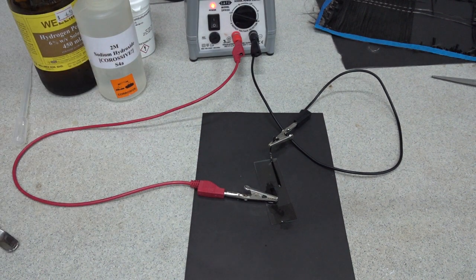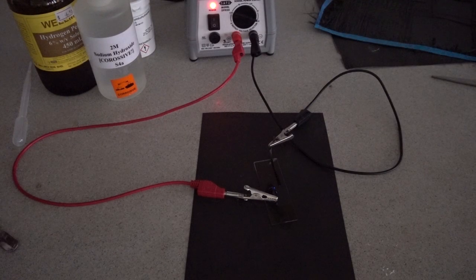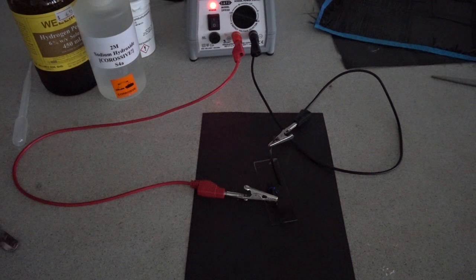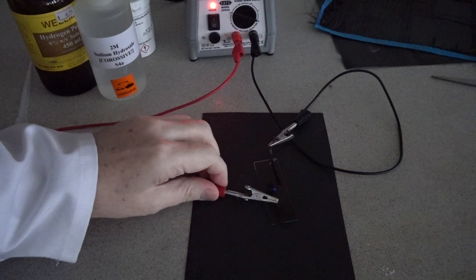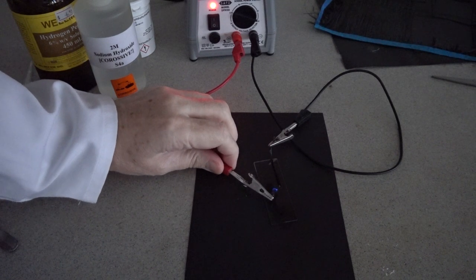So we need to darken, and once we do that you might be able to detect some of the chemiluminescent blue color there.